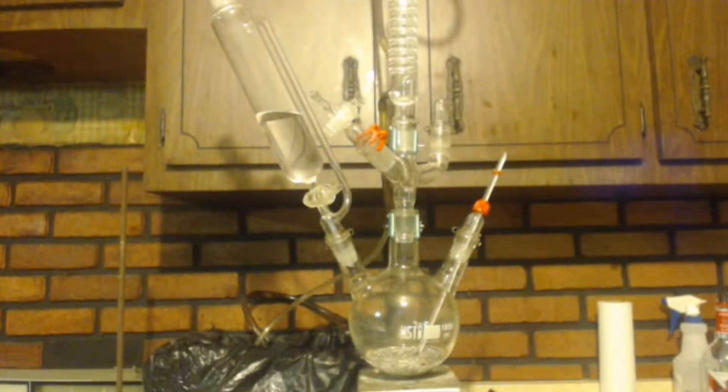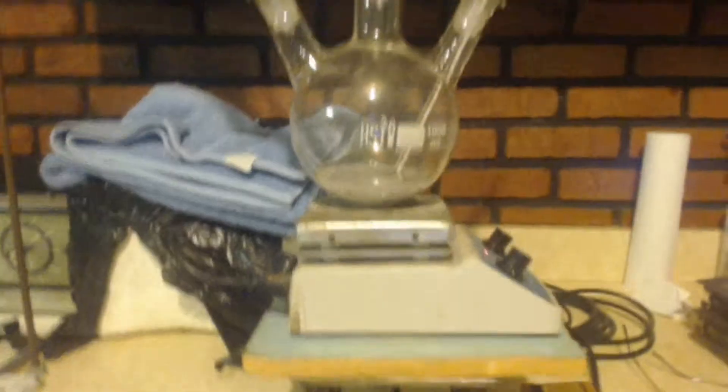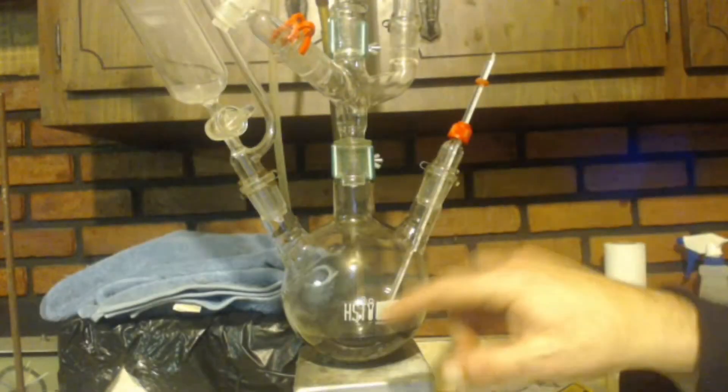Another difference: I have a stir bar on here. You can see the color I wanted — that milky color, I like that milky look. It's going up now — I just started dripping in maybe 10 milliliters and the temperature went up from about 20 to 25°C, so I kept dripping. I've now got all the ethyl bromide in there, so I've made my nucleophile — ethyl magnesium bromide, the Grignard reagent.